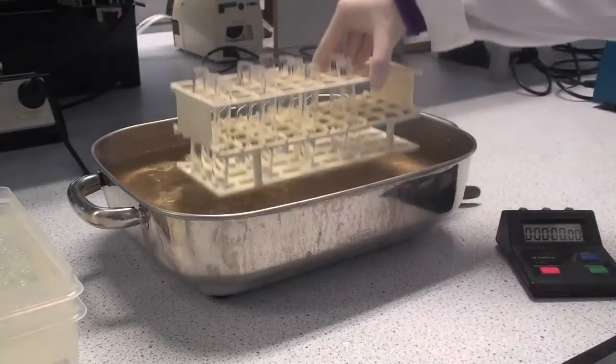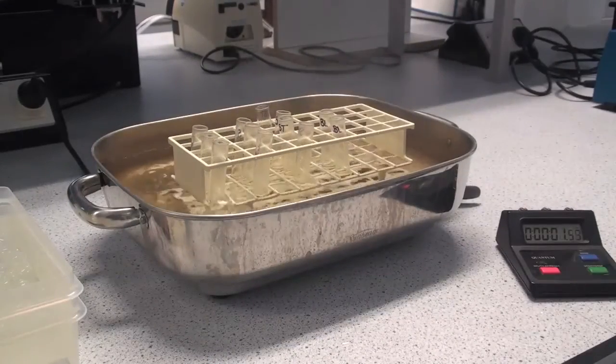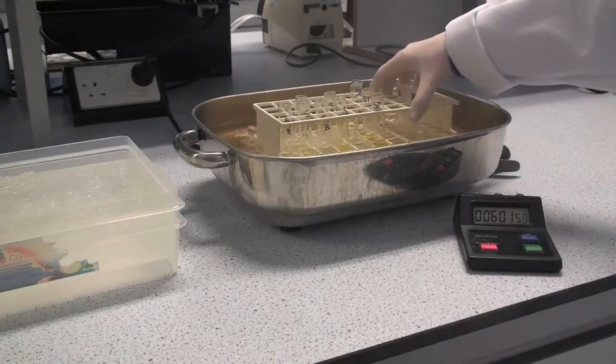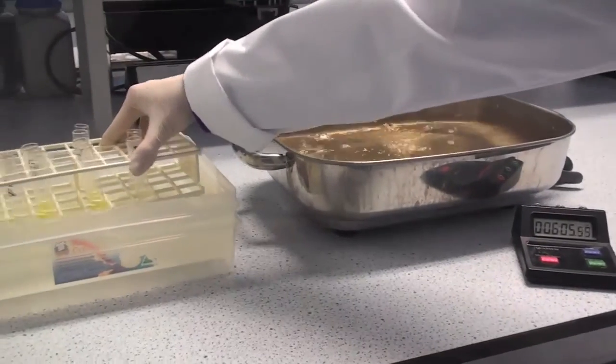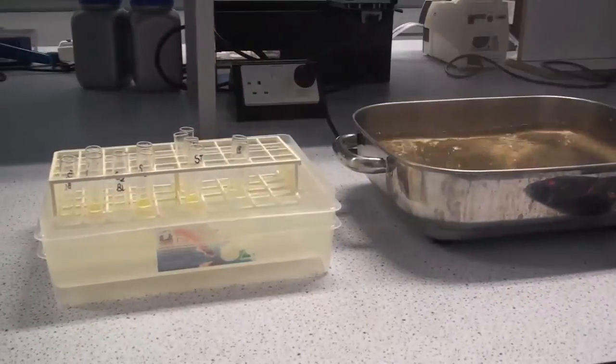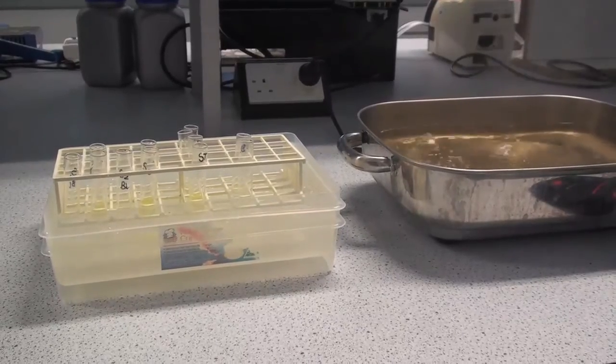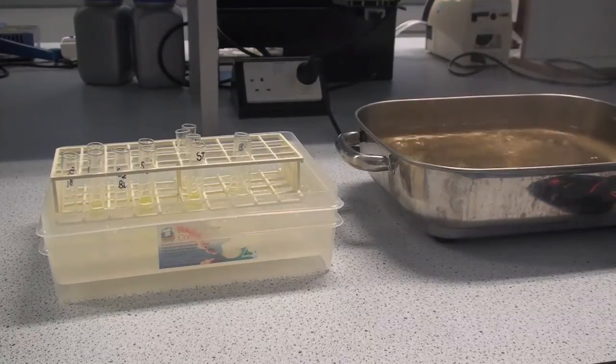Incubate the rack of tubes in a boiling water bath for exactly six minutes. After exactly six minutes, remove the tubes from the boiling water bath and immediately place the rack in a cold water bath or an ice water bath and leave there for approximately five minutes.